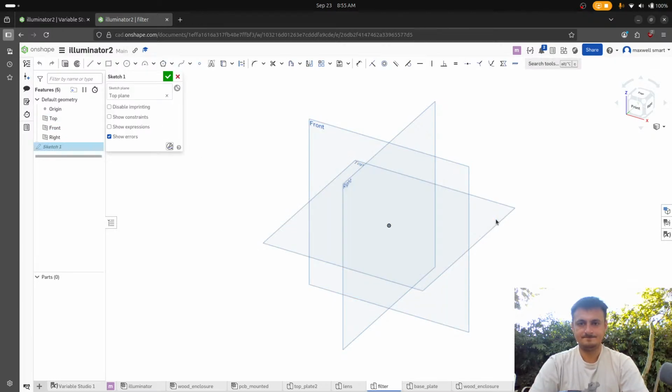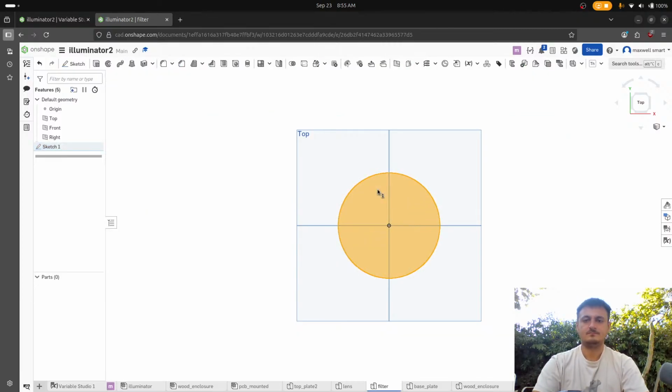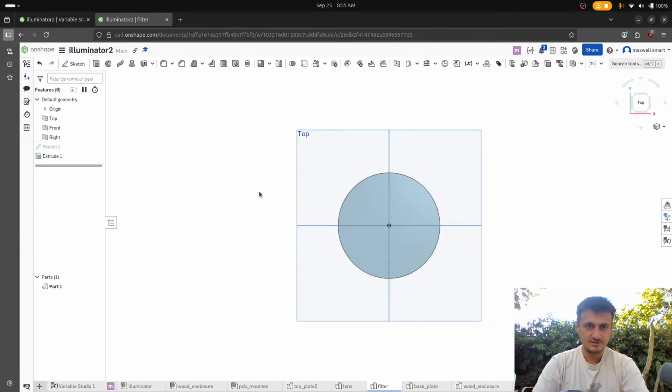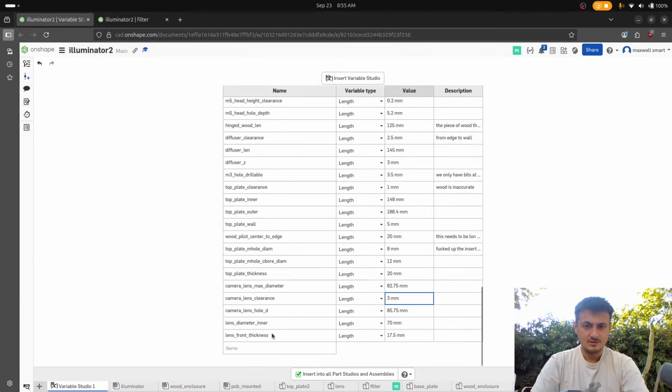Okay, so we're gonna rename this, so that's fine, but we're gonna rename this to lens front filter. Okay, I knew to do that.